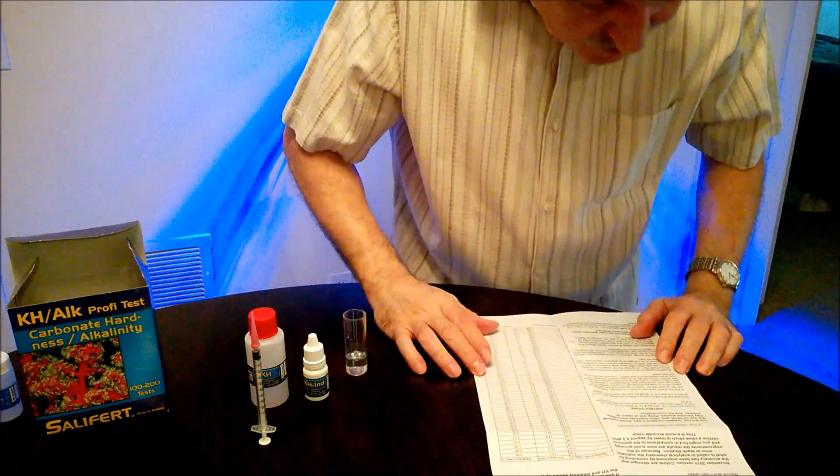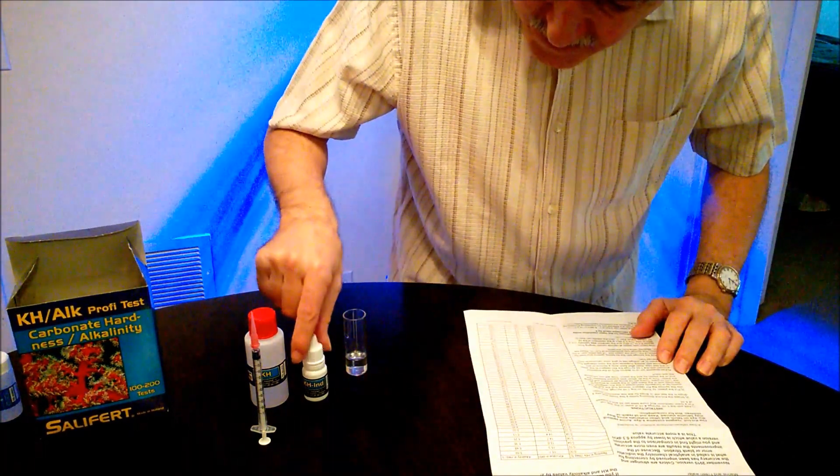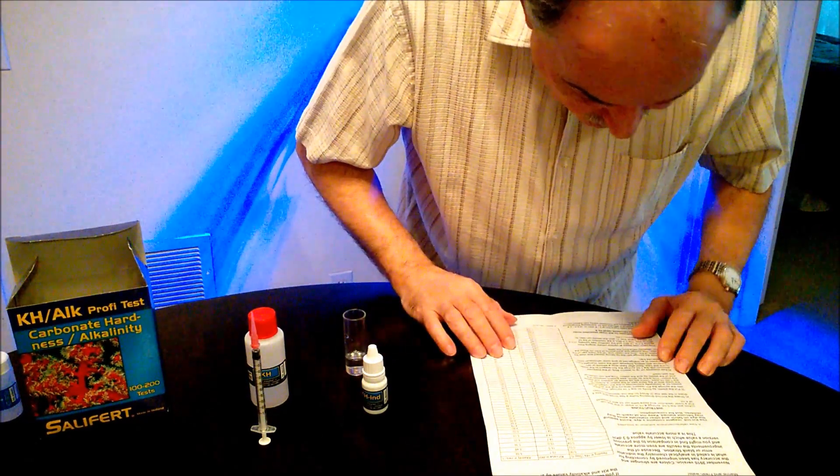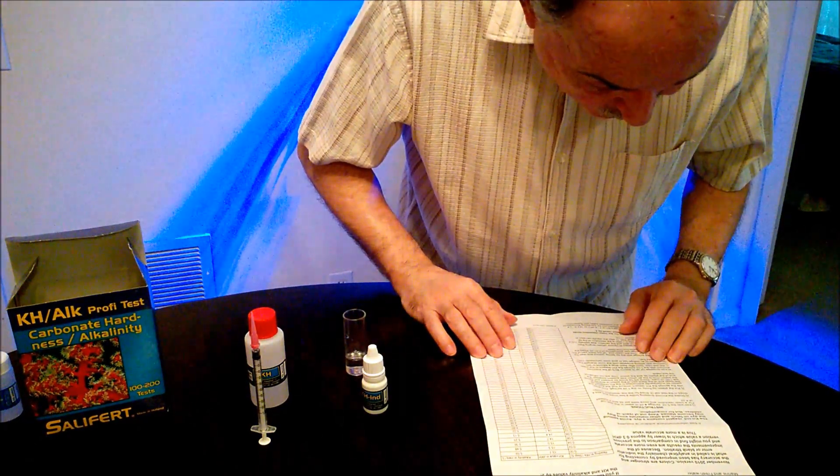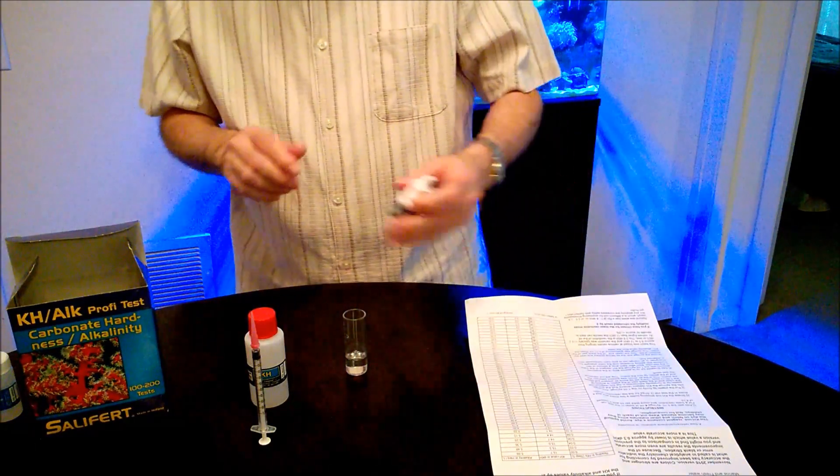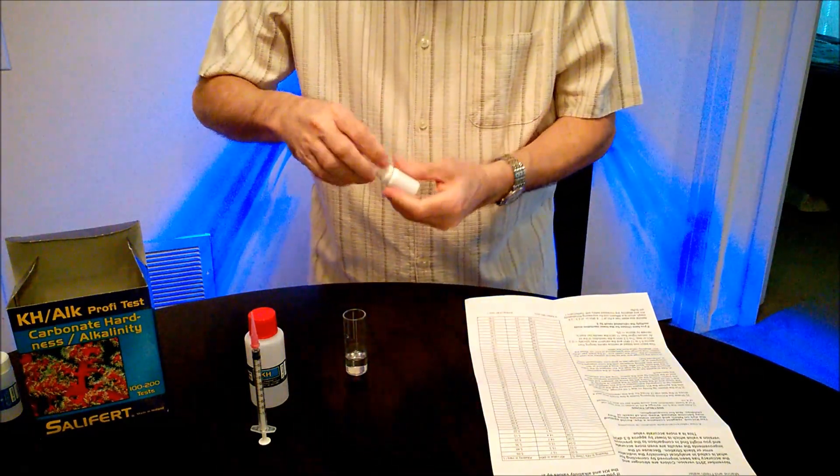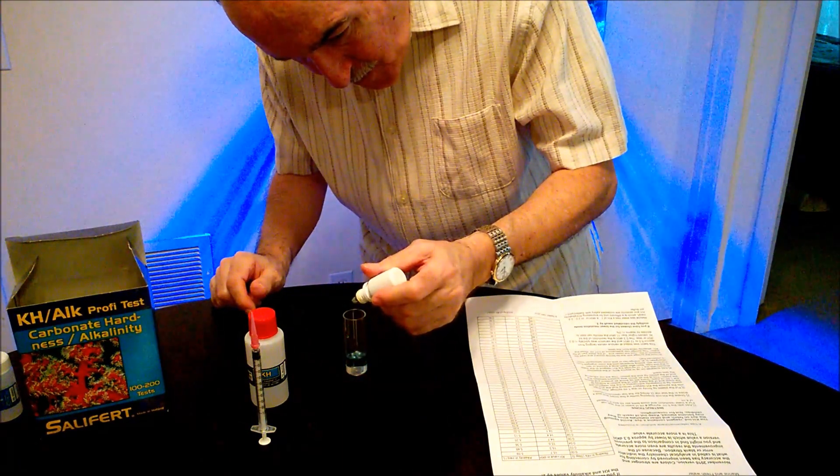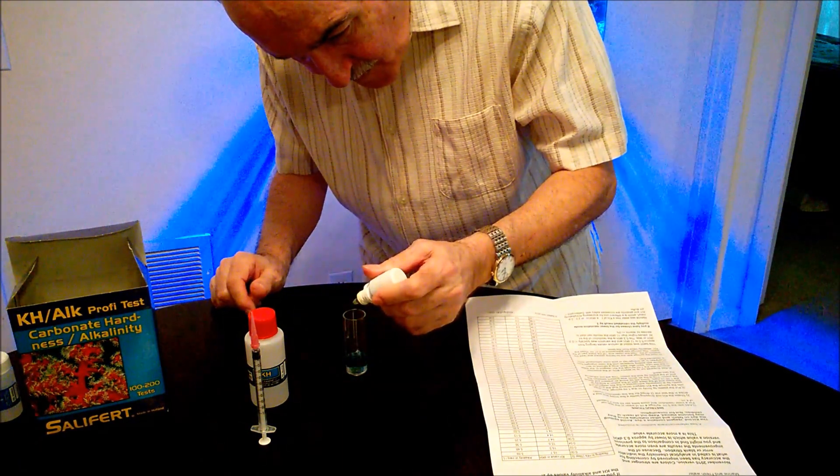And then instruction number two. It says take the KH-IND, which is this little bottle, shake it a few times and add 4 drops. Okay, here we go. One, two, three, four.